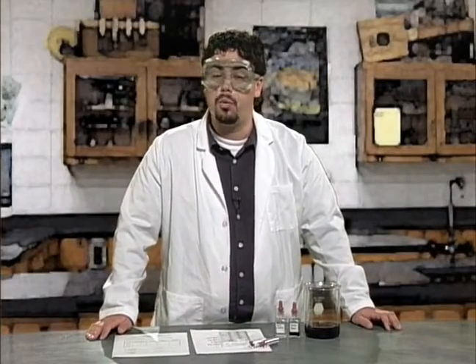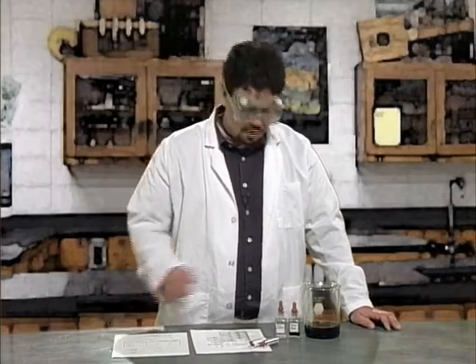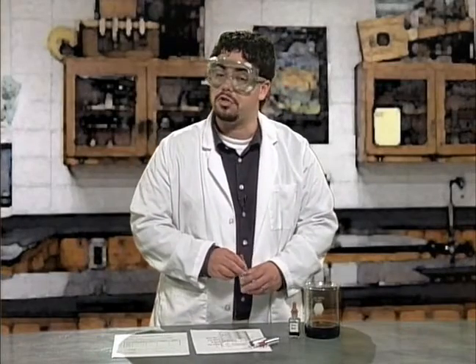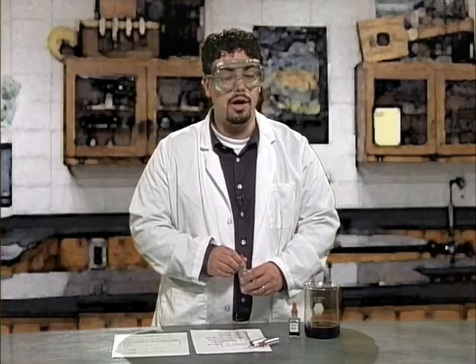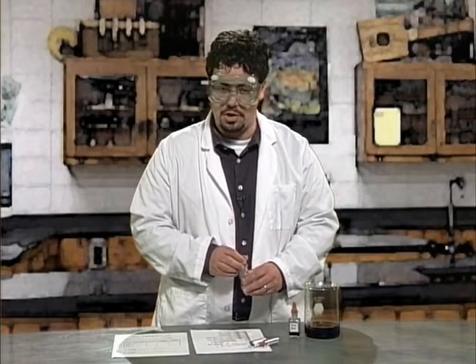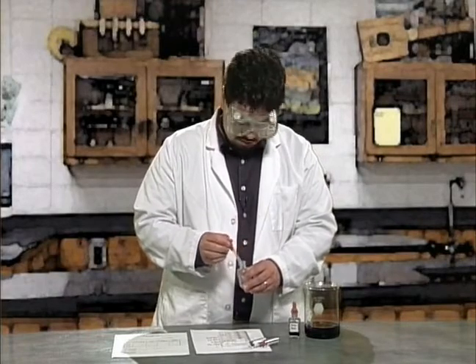Now that I have rinsed the well plate and replenished the samples of acids and bases, let's put a few drops of phenolphthalein into each solution. Note the color change in your chart. Again, write NC if there is no change. The first solution tested will be HNO3.